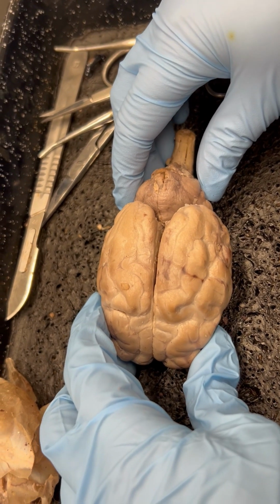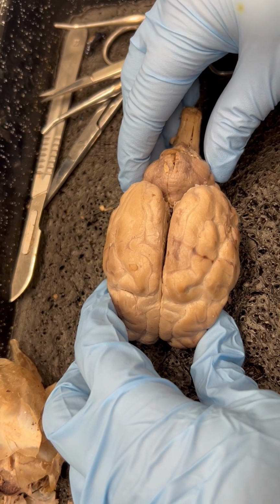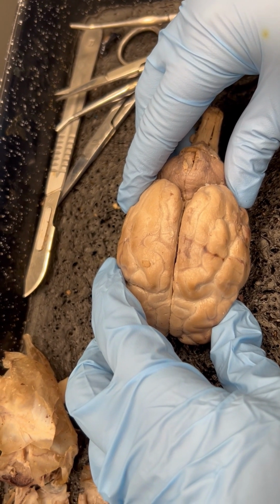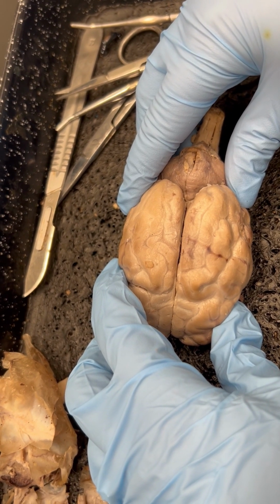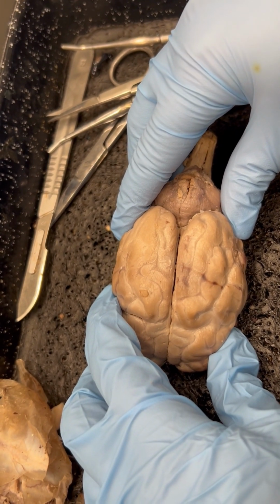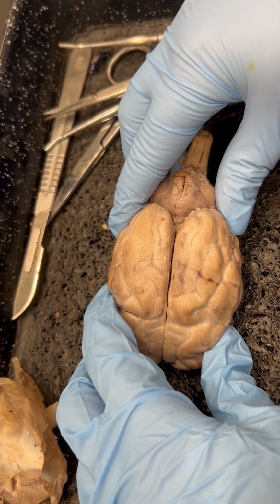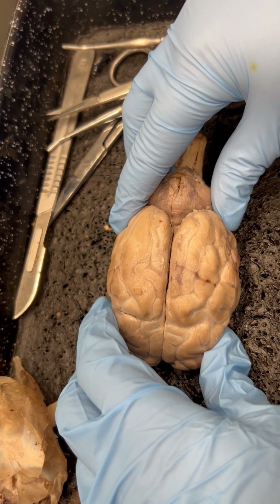For this video, we're going to be discussing figure 10.12. And for this image, there's a lot of terms. So it's going to be really important for you to read your lab manual and compare this video to your lab manual. And also, a lot of the structures can be difficult to see since the tissue is the same color. So it's going to be really important in your lab manual to read the descriptions of these structures because that will help you identify things in real time.